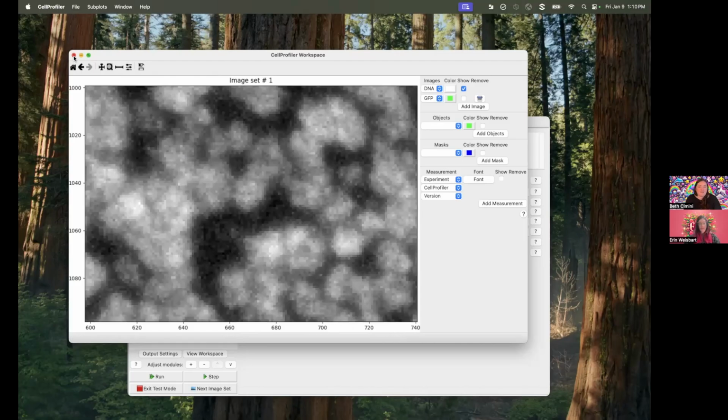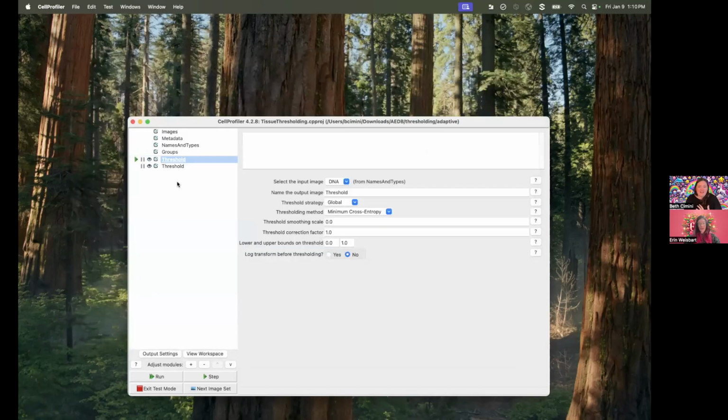I want to jump and just answer the specific thing she's having a problem with, which is, well, some of these are brighter, some of these are dimmer. What do I do about it? So here I'm showing you the threshold module. I'm not using identify primary objects just because I really want to emphasize where the issue is coming from. But identify primary objects uses all of the same settings as the threshold module. In fact, it literally just brings the threshold module in sneakily under the hood. So you'll get the same effect here.